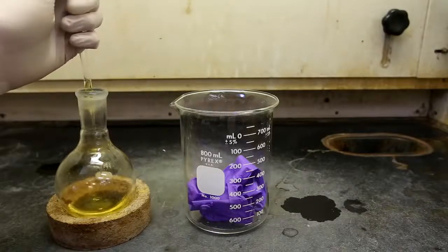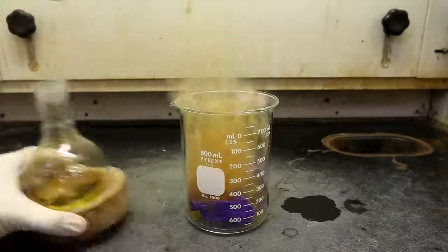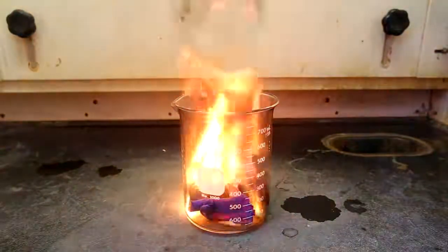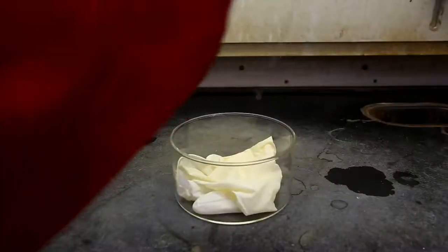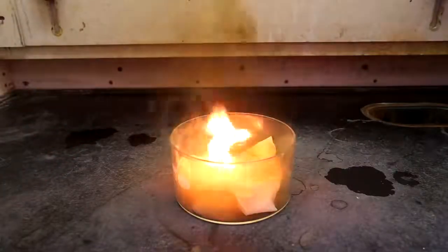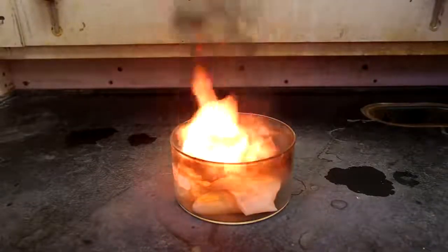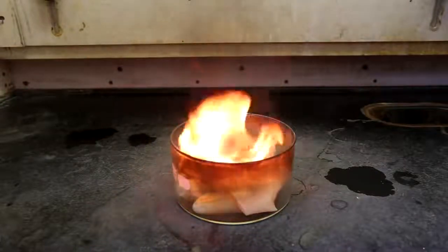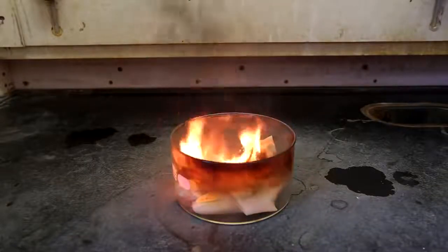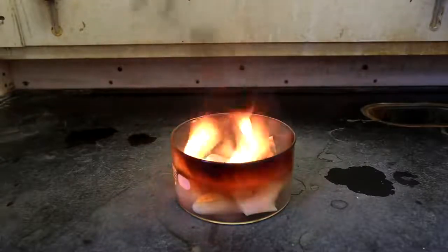Next is a demonstration of what fuming nitric acid does to typical lab gloves. About 2 ml of fuming nitric acid on nitrile gloves causes the nitrile gloves to quickly burst into flames. Adding 2 ml to latex gloves has a similar result. This demonstrates that lab gloves are not perfect and are susceptible to chemicals. When dealing with fuming nitric acid, if all you have is latex or nitrile gloves, it is recommended to not wear any gloves at all. The only gloves that will protect you from a spill of fuming nitric acid are butyl rubber gloves.